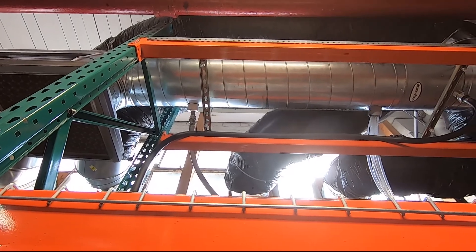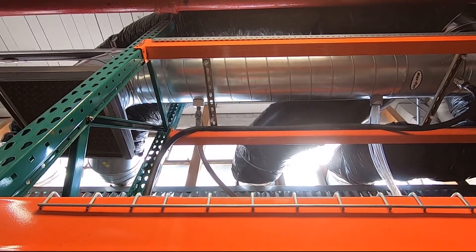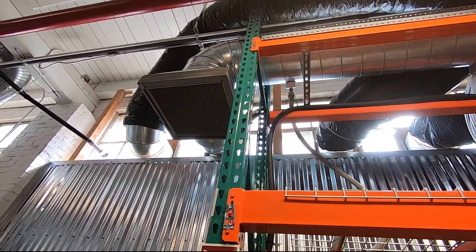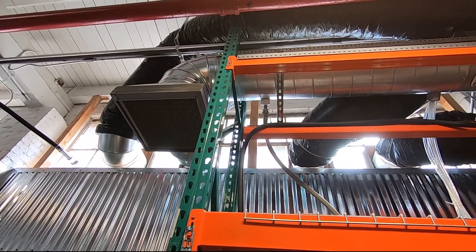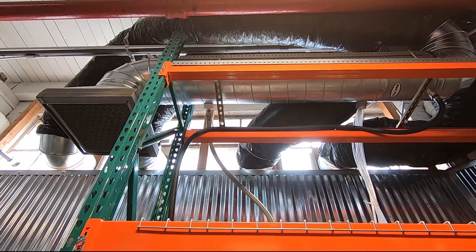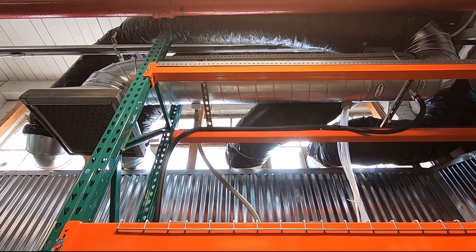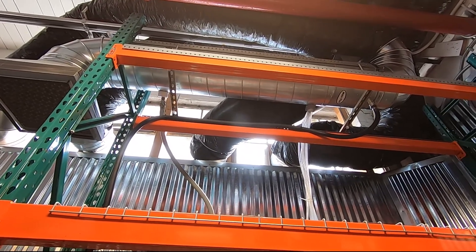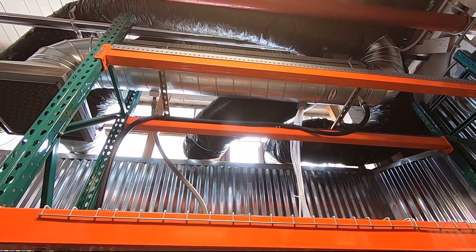We're draining it out there, and this is completely air cooled. We've just got a filter on the end to keep the coils clean, with about a 1800 CFM fan — so it's sort of doing double duty, ventilating the room as well as cooling the alcohol and condensing it.